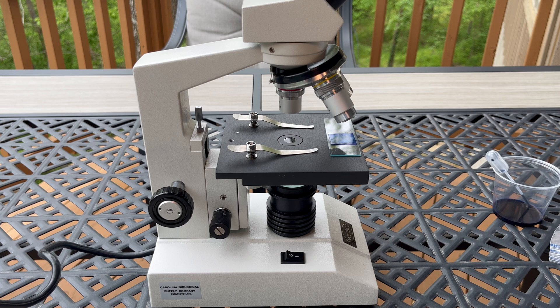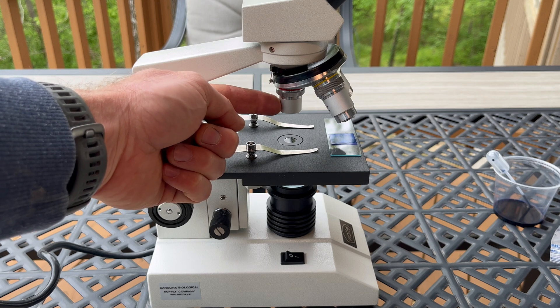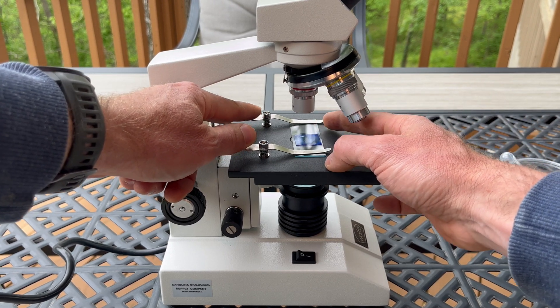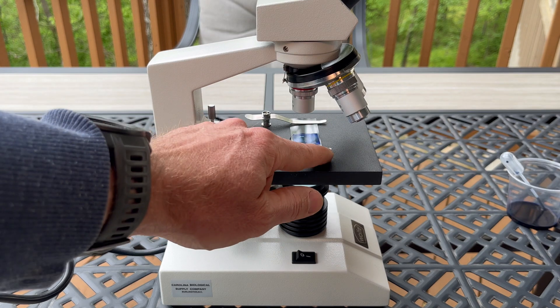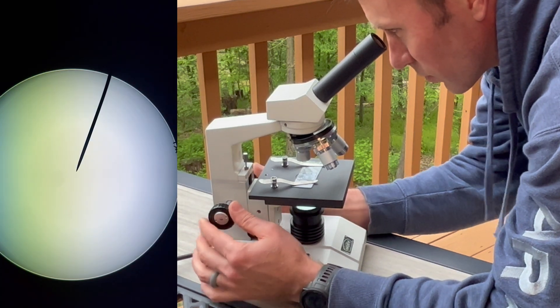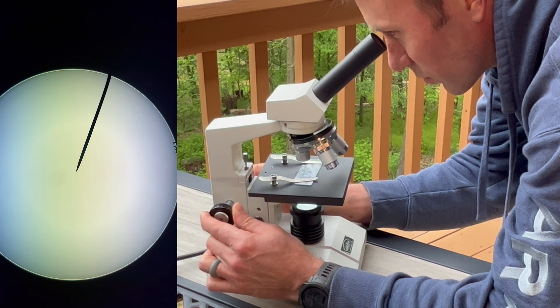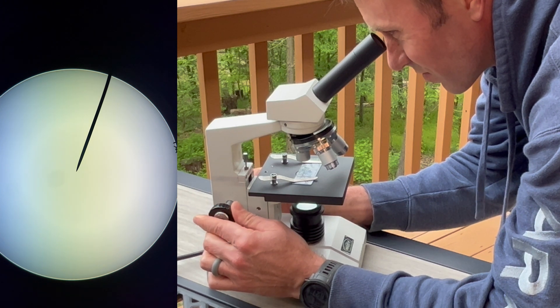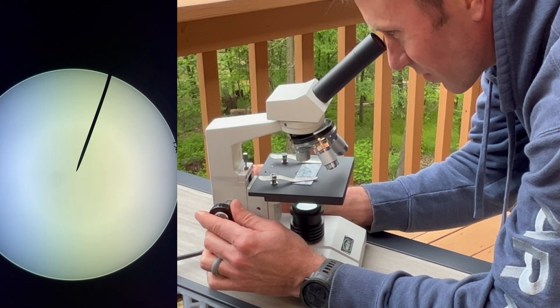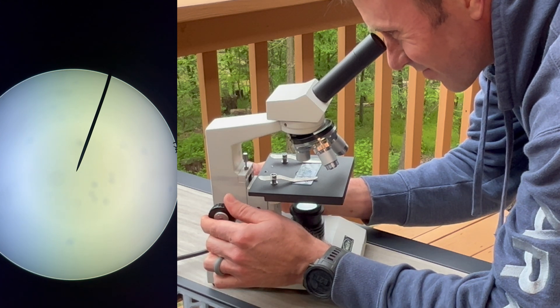It's time to place the specimen under the objective lens. Make sure the smallest objective lens is directly over the hole in the stage. Press the back of the stage clips and situate your slide so your specimen is over the hole in the stage. This next step requires patience — slowly turn the coarse adjustment knob until something comes into focus. It just takes time; you have to turn the knob slowly and watch carefully.